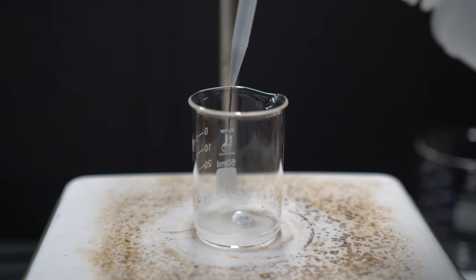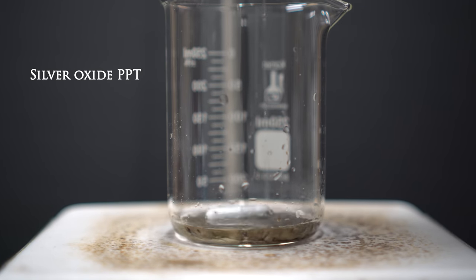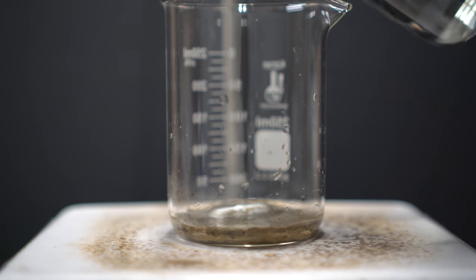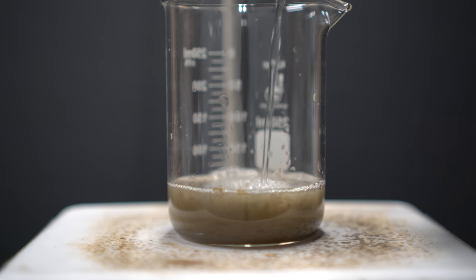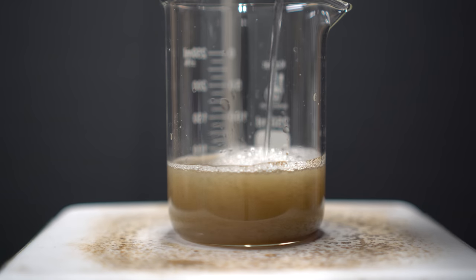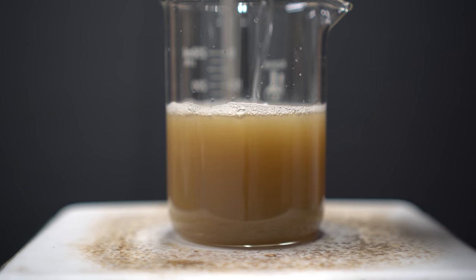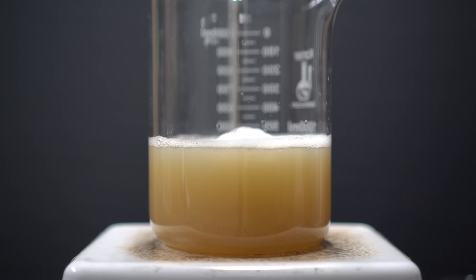The sodium hydroxide was also dissolved with a minimal amount of water. I then poured the sodium hydroxide solution into the silver nitrate solution. The precipitate that forms is silver oxide, which is not very soluble, so we need to add ammonia to make it more soluble. The only issue is that when I added the ammonia it really didn't dissolve — the solution should go clear, and mine didn't go clear at all. I just kept adding and adding and it really didn't change anything. I ended up transferring to a larger beaker, but it still didn't dissolve and I wasted a lot of ammonia. It's not supposed to be that orange color.